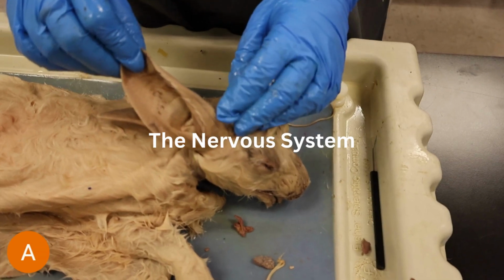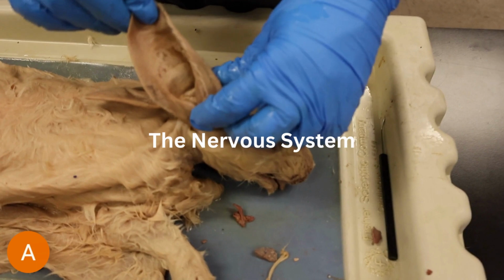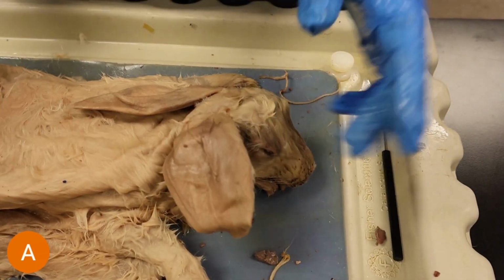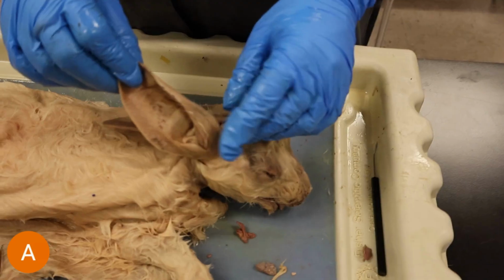Okay, so now we're on to the nervous system. The nervous system does consist of the brain and the sensory organs. So here we're showing you the sensory organs. These consist of the ears that allow for hearing, the eyes that allow for seeing, as well as the nose that allows for smell. These allow the animal to find food more efficiently, as well as avoid predation better.